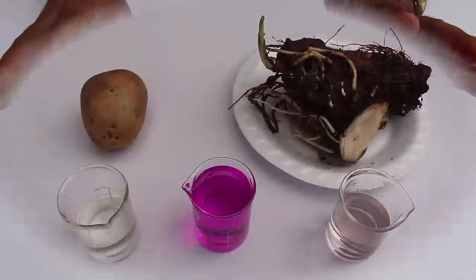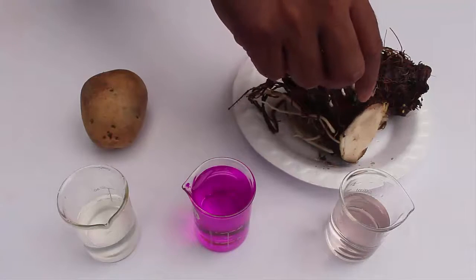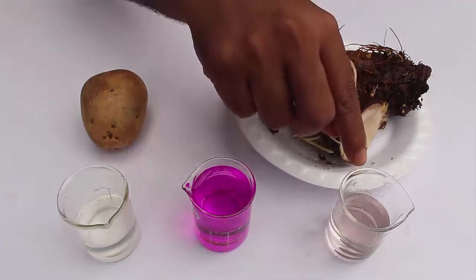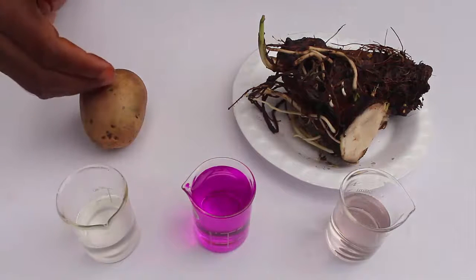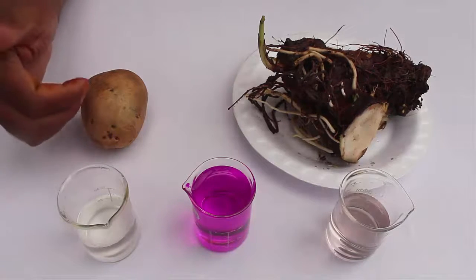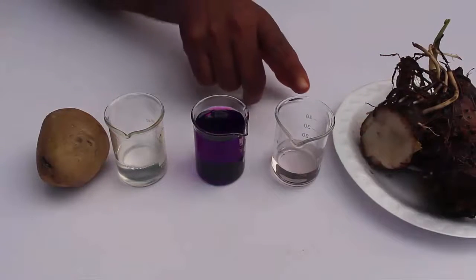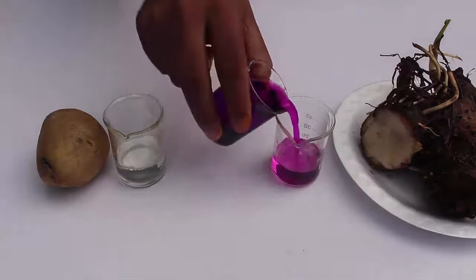On my right side is the extract from the taro root, and on my left side is the extract from the boiled potato. Now I will add potassium permanganate solution to both extracts — first to the taro root, then to the potato.